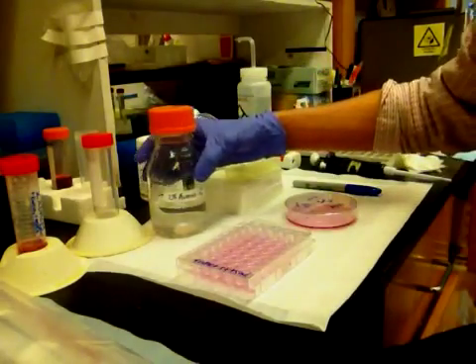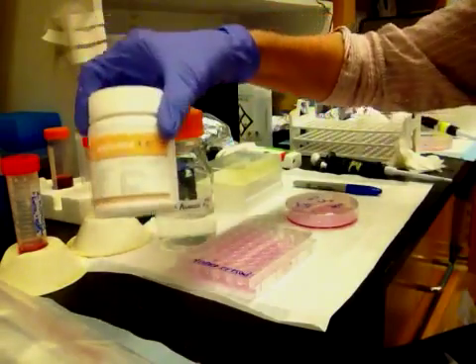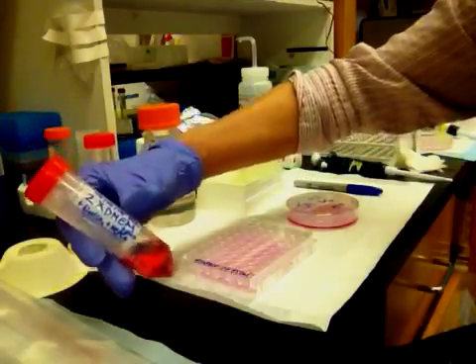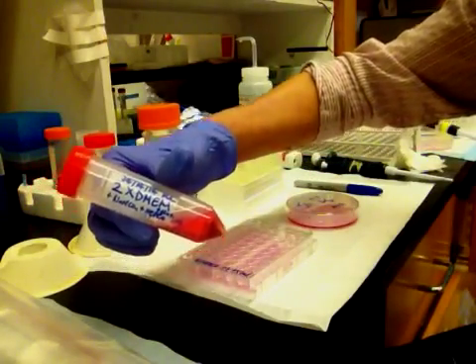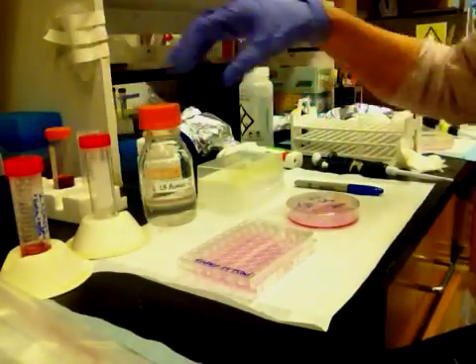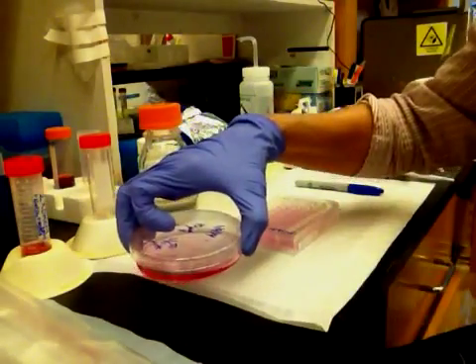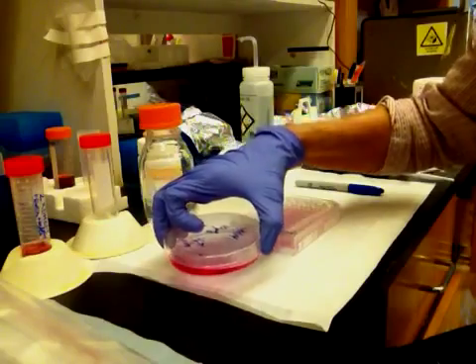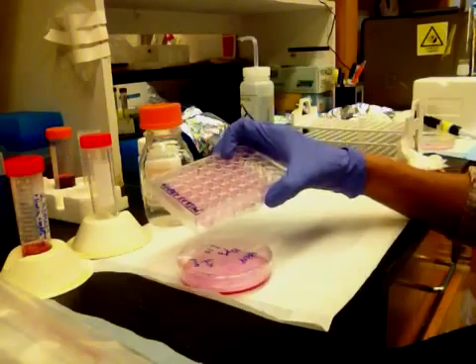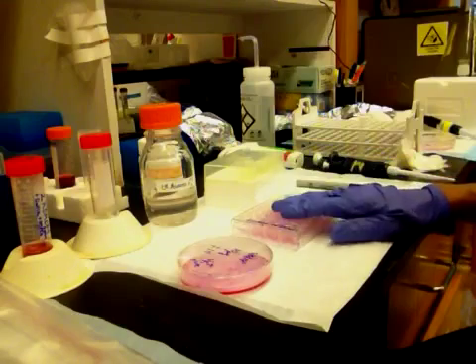In preparation for this, I have microwaved 2% agarose — simply agarose in water — and I have prepared a 2x solution of DMEM so that the final solution, when mixed one to one, will be isotonic. I have a plate of cells that have grown in selective medium with circled colonies, and a 48-well plate with about 100 microliters of selective growth medium in the bottom of each well.